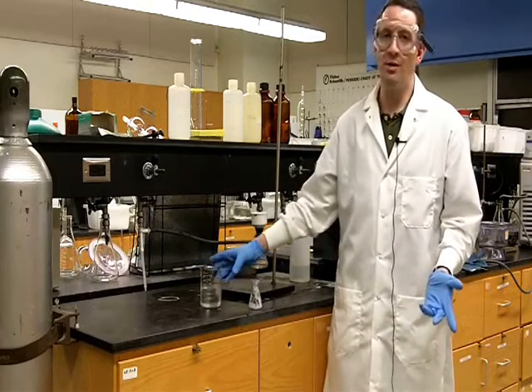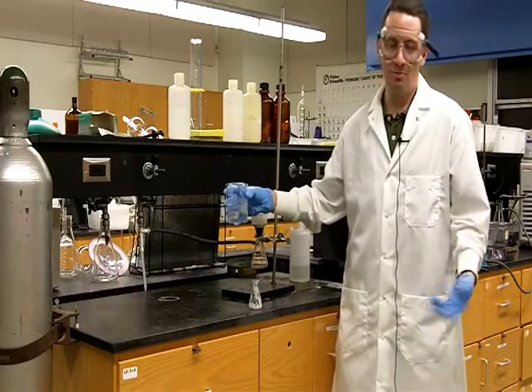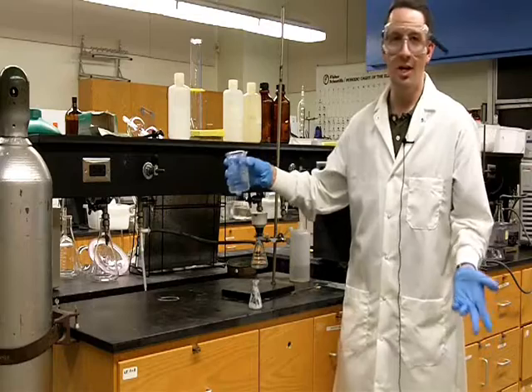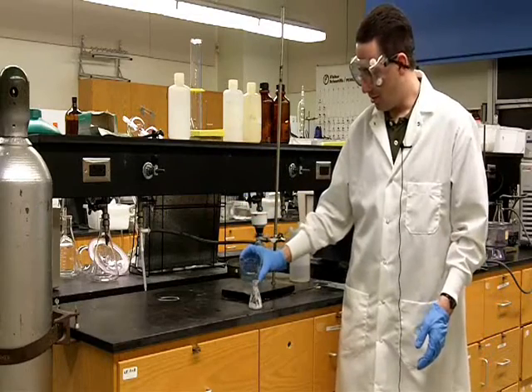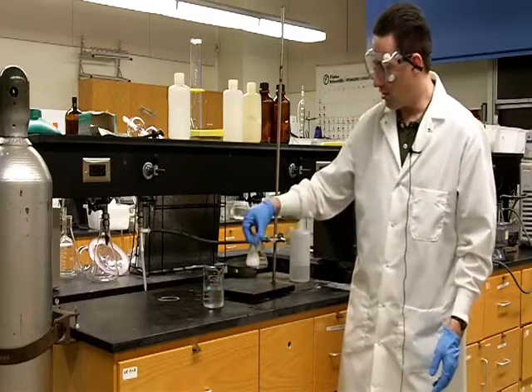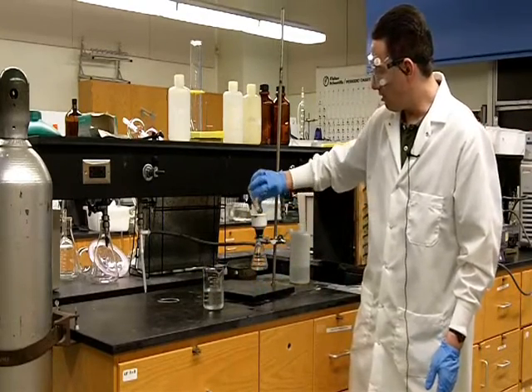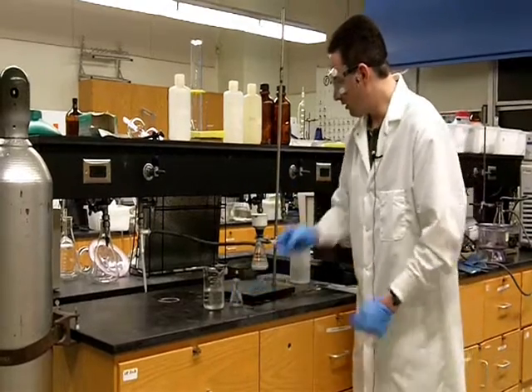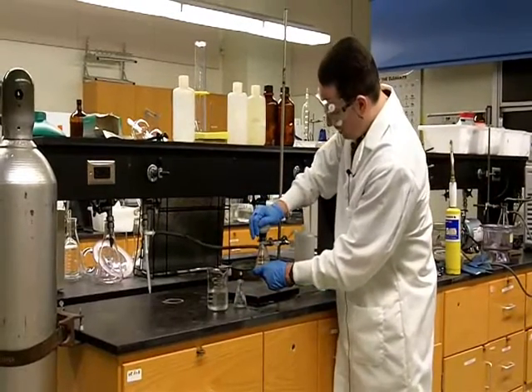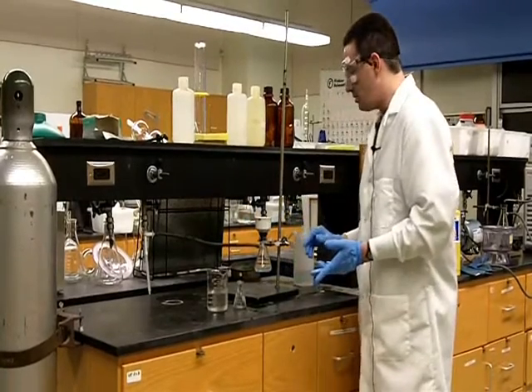One of the convenient things about water is I don't need to make a separate solution or put a separate flask in here. I have ice water here, which is going to be at the right temperature, and so I'll just pour a small amount of the ice water in here, and then we'll pour that into our funnel as well. And then I'm just going to push down on the funnel to make sure we're getting as good a vacuum as possible.